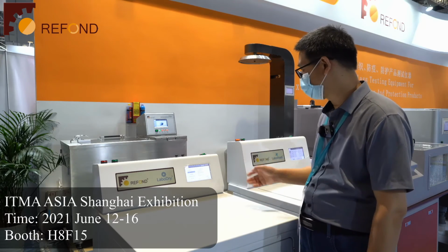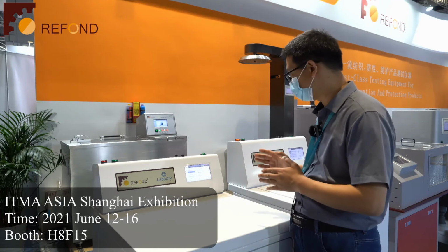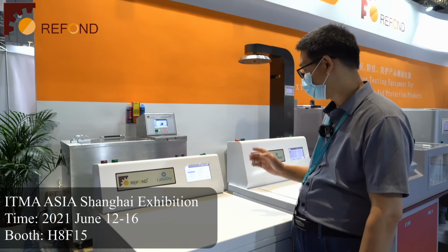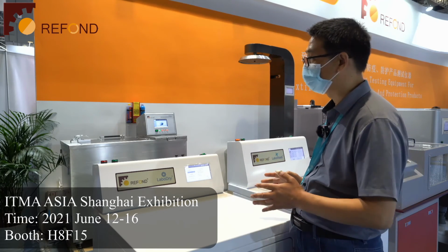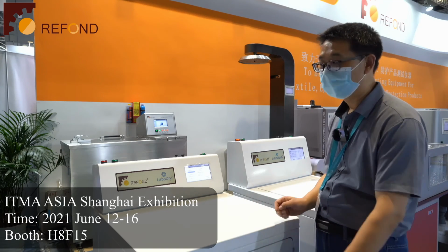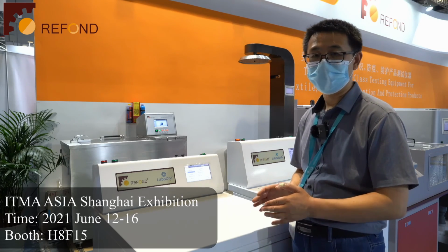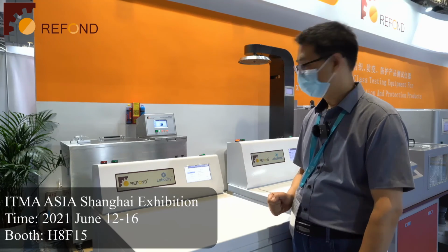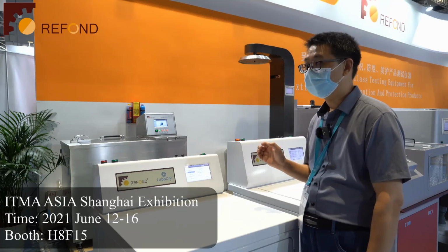After the customer has the experience, they can decide what is the targeted humidity they want to set. Once they set the targeted humidity, they can control the drying condition of the specimens inside the drum. So it can protect the specimens inside from over drying or less dry. This is our new function of the drying machine.